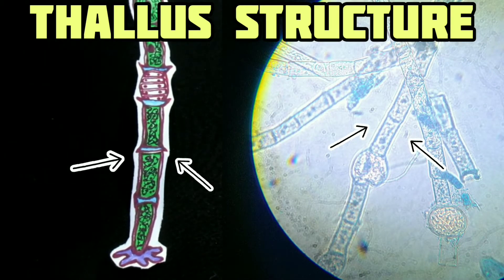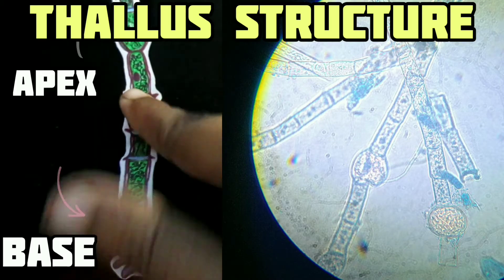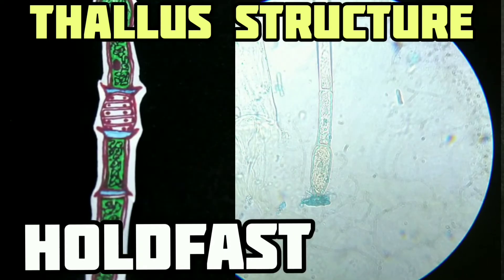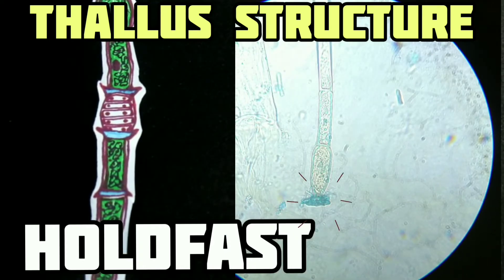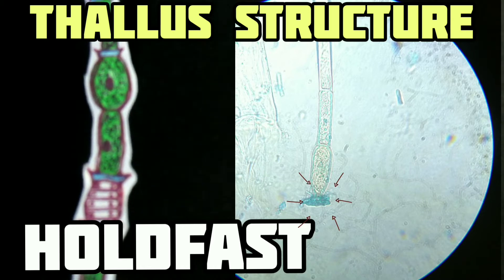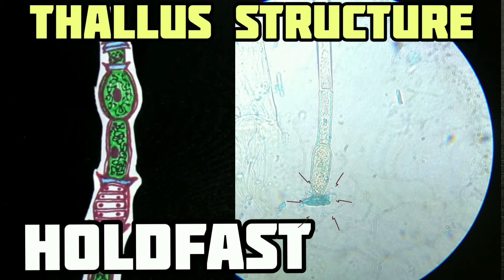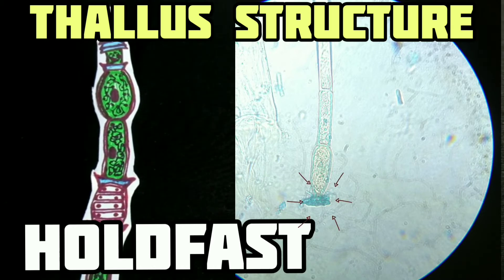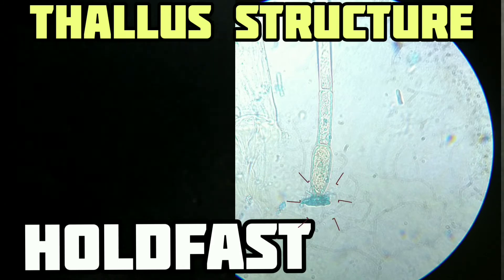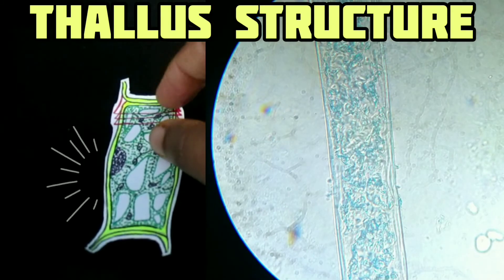The plant body is an unbranched filamentous thallus which consists of cylindrical cells joined end to end. The mature filament is differentiated into base and apex and consists of vegetative cells. The basal cell is always modified to form a disc-like, colorless holdfast, by means of which the plant remains attached to the substratum underwater.